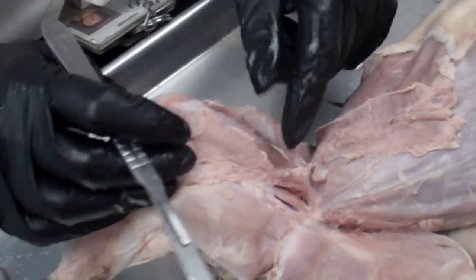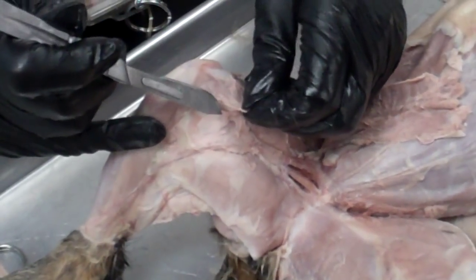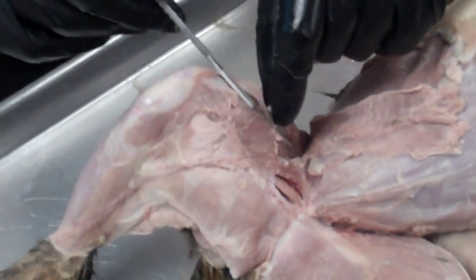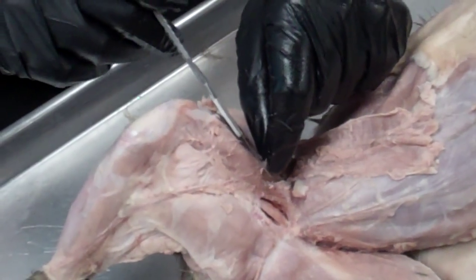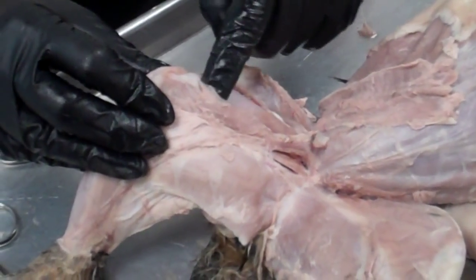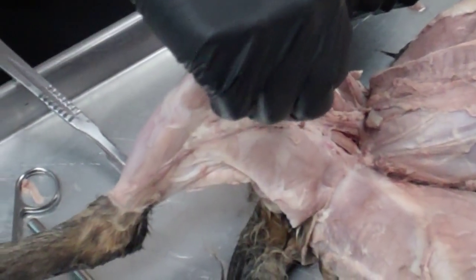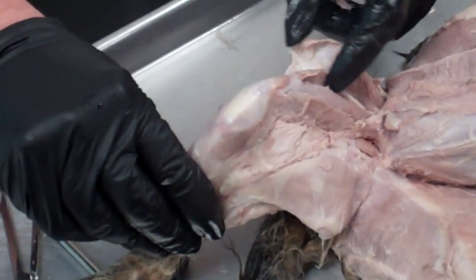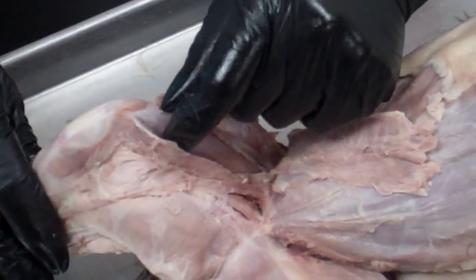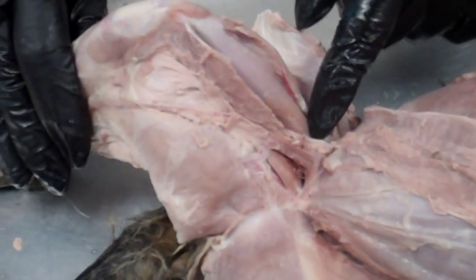Right here, this muscle could use a little cleaning of the fascia material. The one here in the middle is the vastus medialis — remember, medialis means toward the middle. On the outside is the vastus lateralis; on the inside is the vastus medialis. And then right in the middle, with the fibers going straight down, this is called the rectus femoris.